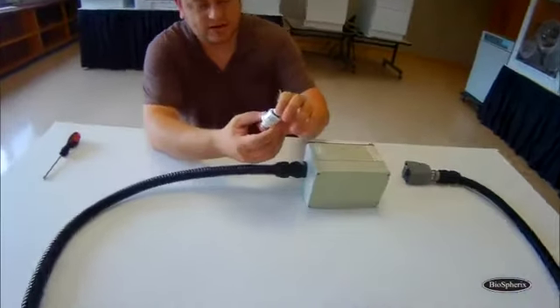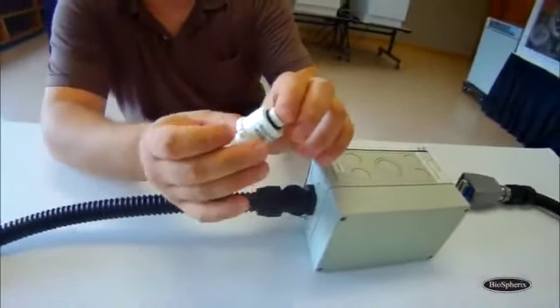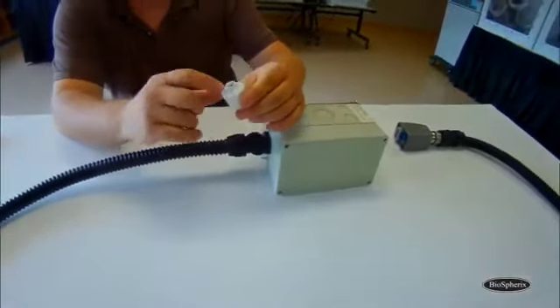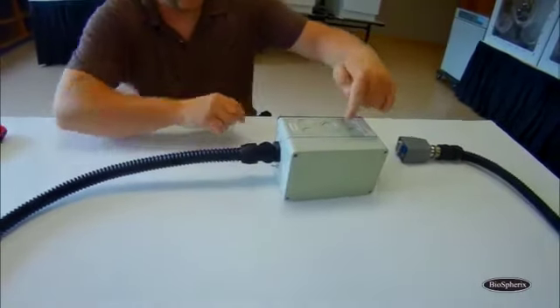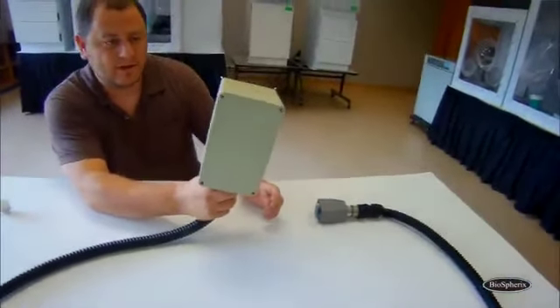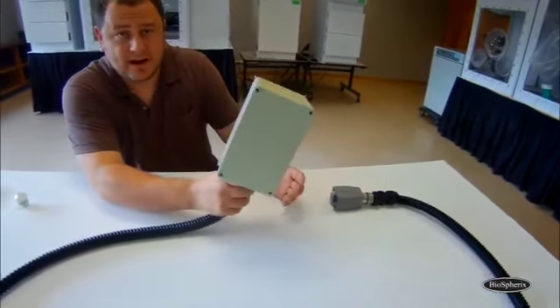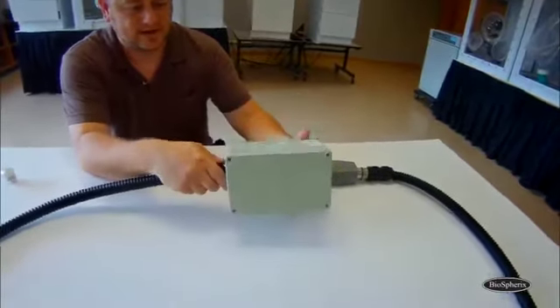So this is what your replacement sensor is going to look like. Sometimes it's clear rather than white, but basically it's a small squat style sensor. It has a connection at the top, some threads at the bottom, and it's located right inside your actuator pod. So this pod normally sits attached to an animal chamber. Depending on how your access to it is, you may not even need to take it off the chamber. I've taken it off here just so we can see.